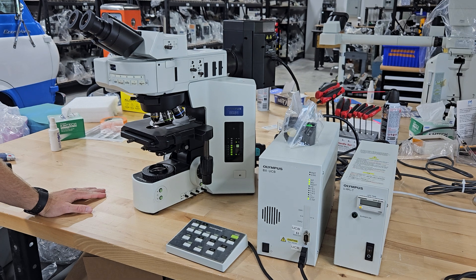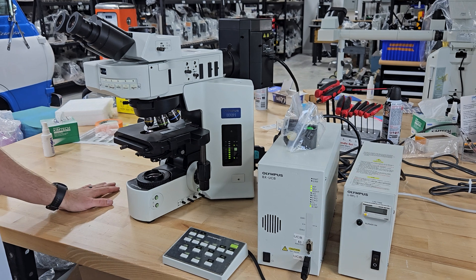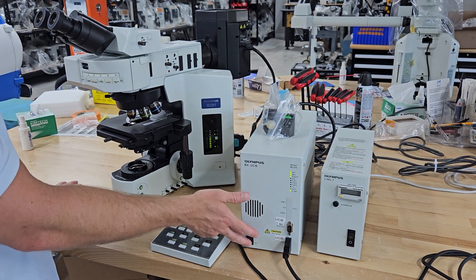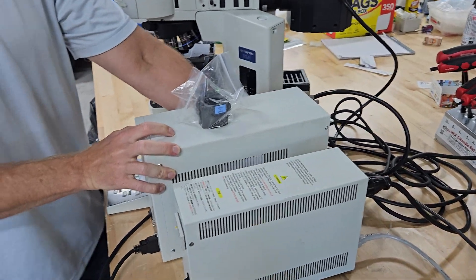We're going to cut it off. If you want to send light to the camera, you pull this rod here. We're going to show you where the cables go and how to assemble it. Cut it back off and make sure it's unplugged, as we spoke about earlier — unplugging right here.